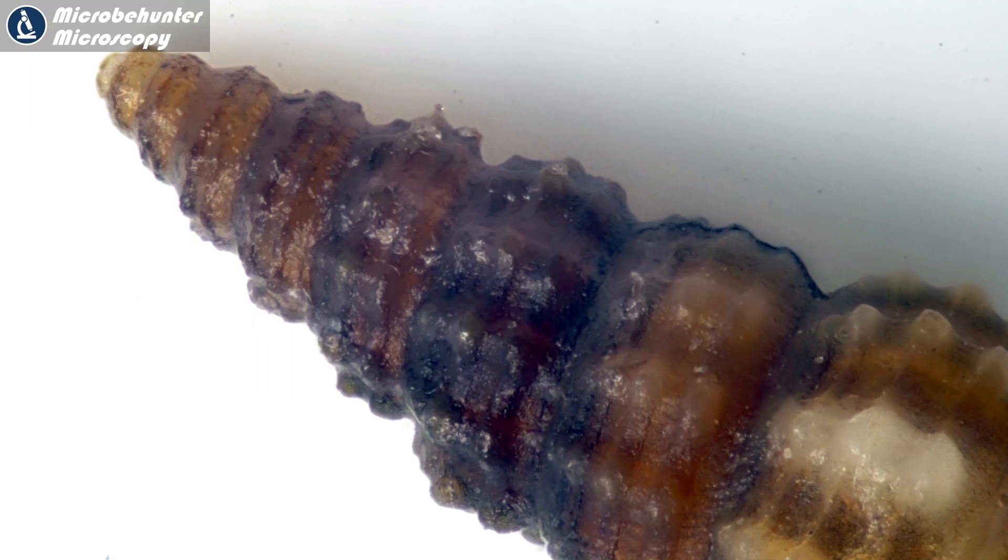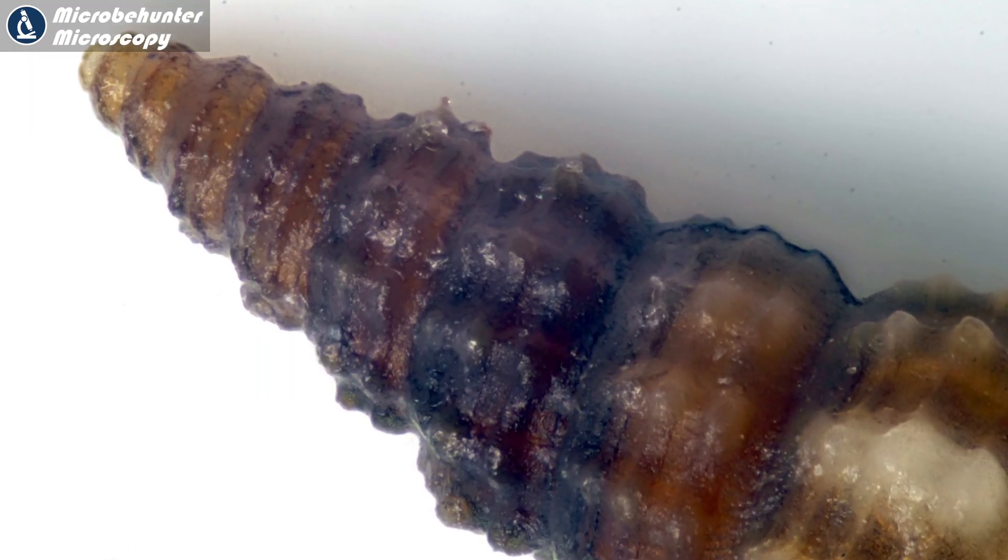There are a full range of different microscopes — fluorescent microscopes if you want to label cells with fluorescent antibodies, and many other specialized microscopes. So initially I said I cannot answer this question; it really depends on what you want to observe. If you want to do a biodiversity count of small seashells, you're going to use a stereomicroscope. So I thought: what in the world am I supposed to answer here?